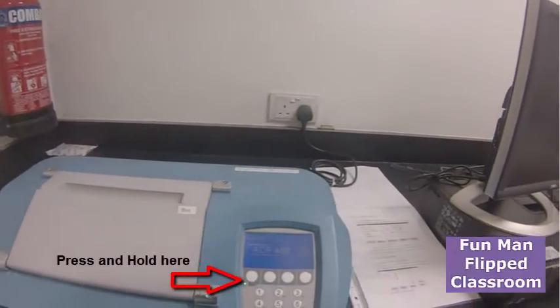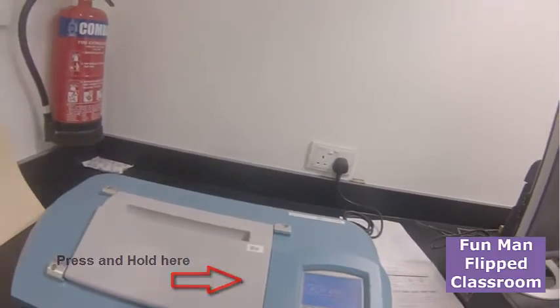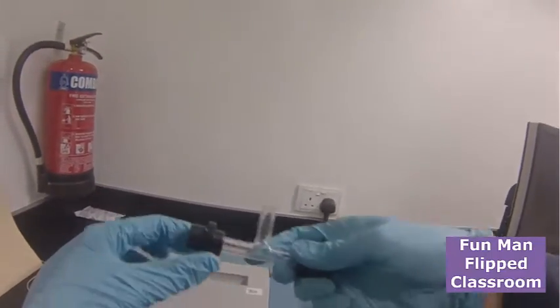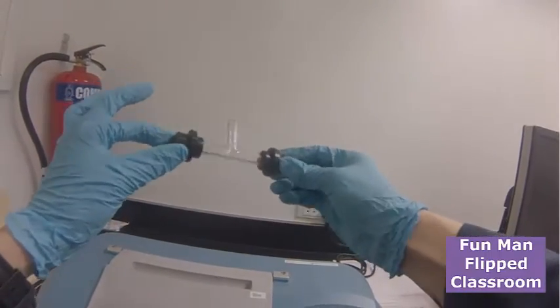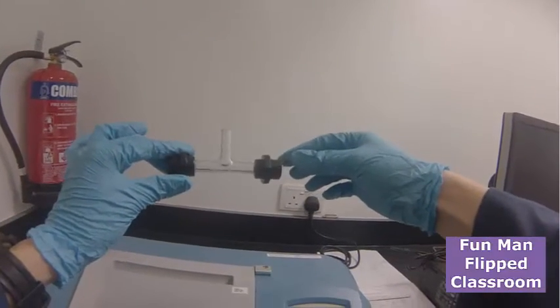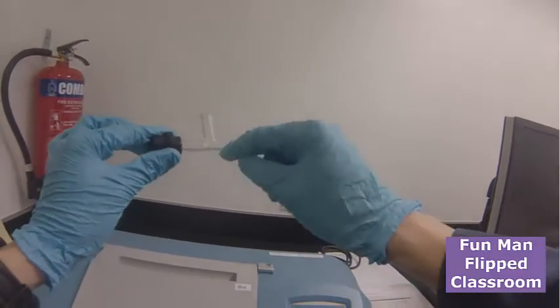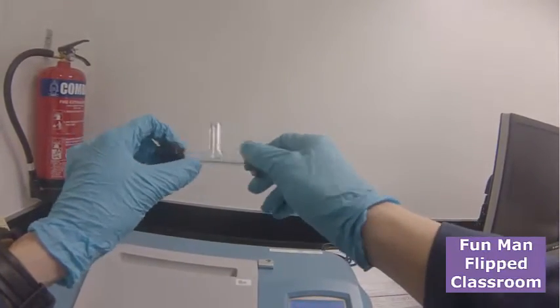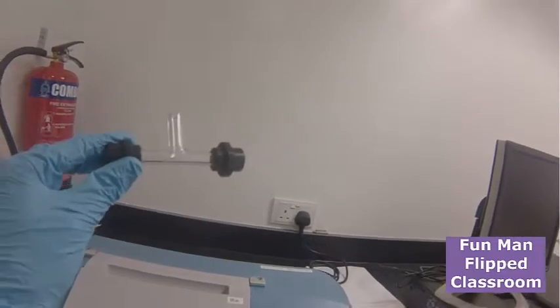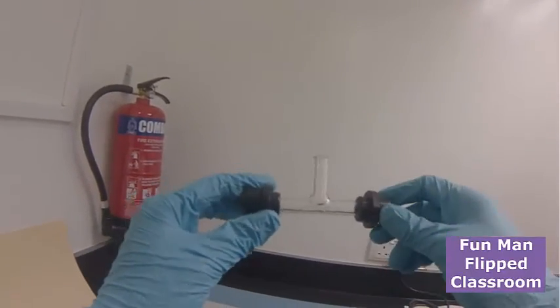You turn on the machine. Over here we have the glass sample cell to contain your solution. See, this is a bit wet with solvent, so dry it with acetone. We're going to see whether it is empty or with the blank solvent—it makes a difference.